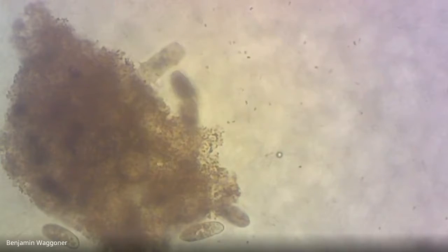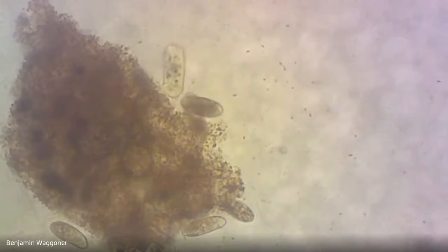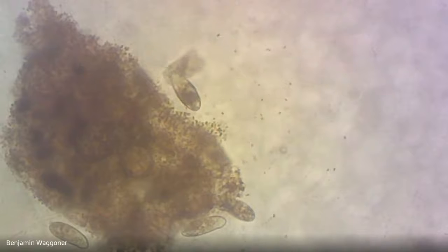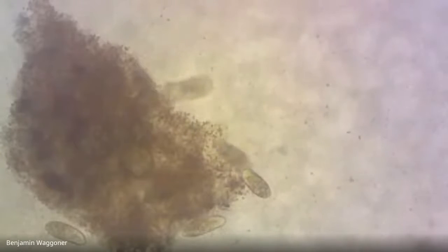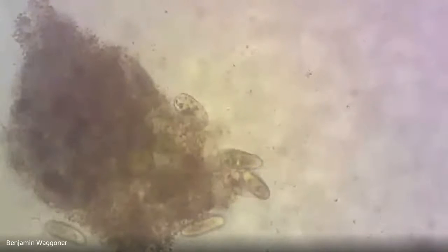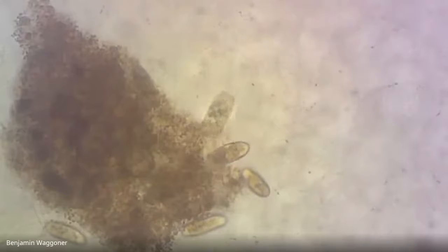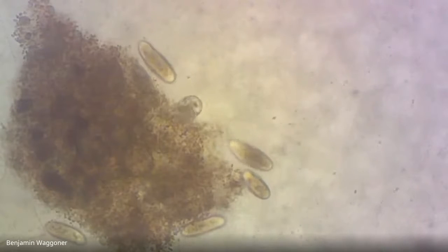And that's the end that he keeps sticking right onto that bit of decaying organic matter, because I assume that's what this one is doing. Organic matter. So there's probably a cell mouth up there at the front end, the end that's closest to the brown blob. And yeah, there we go. So we've got a nice little ciliate community right here.